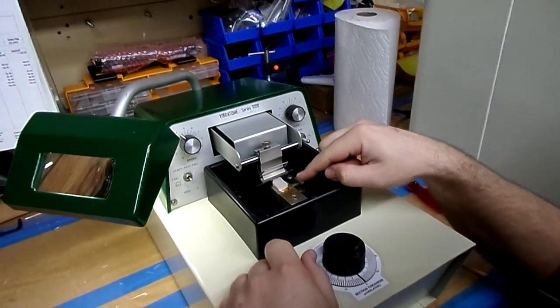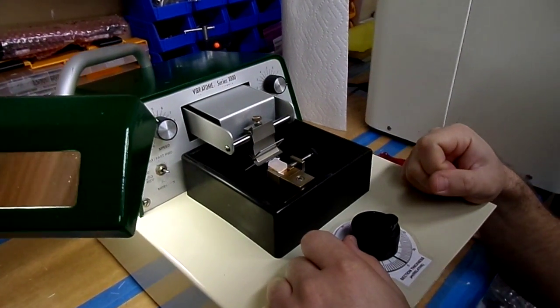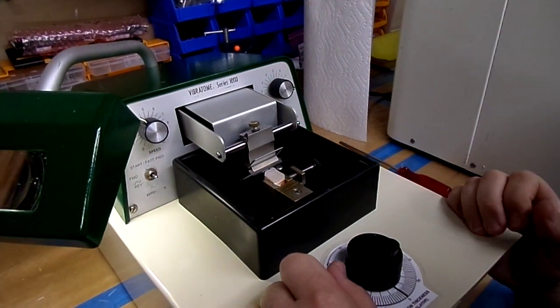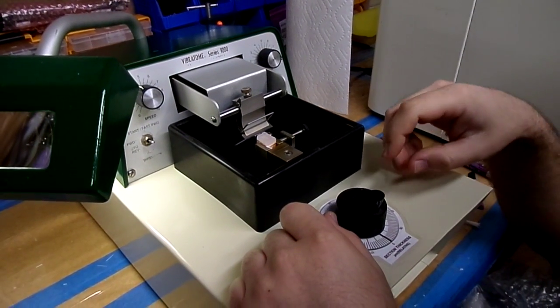Today we're going to be using just a wood block with some wax on it. It's not the ideal medium for cutting, but it's going to work fine for display purposes. We don't want to cut a chunk of person for this.